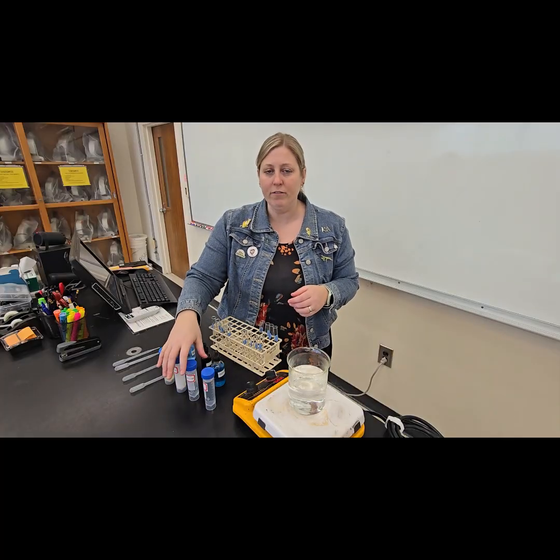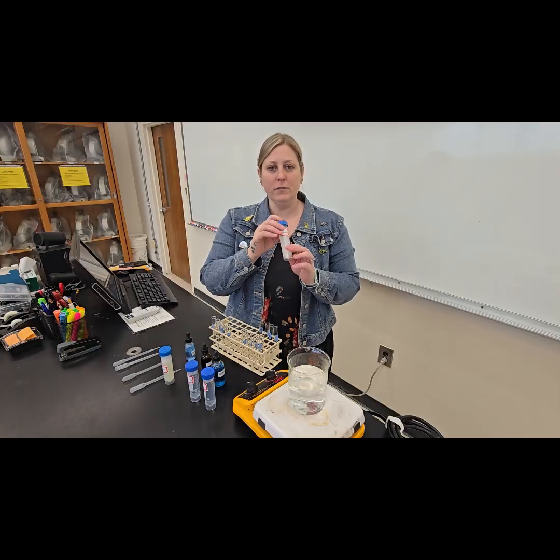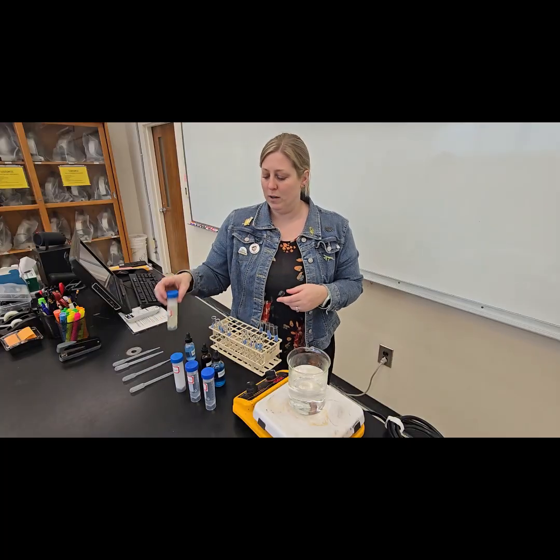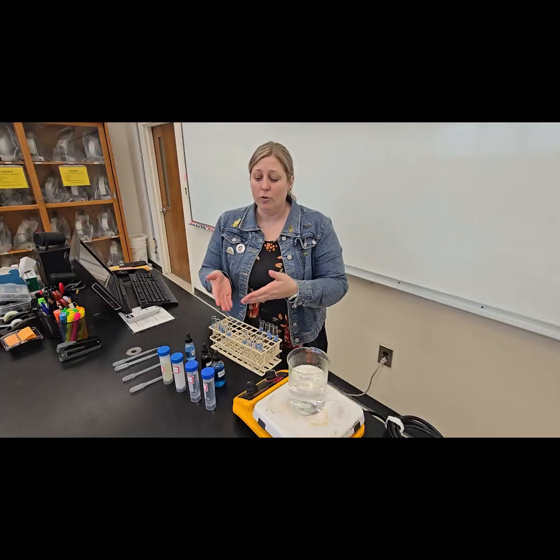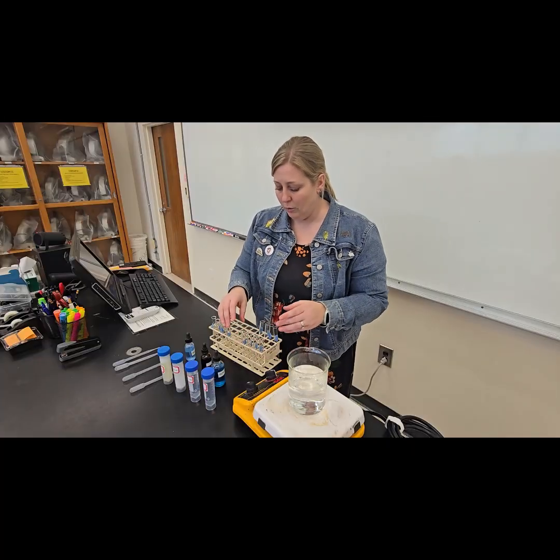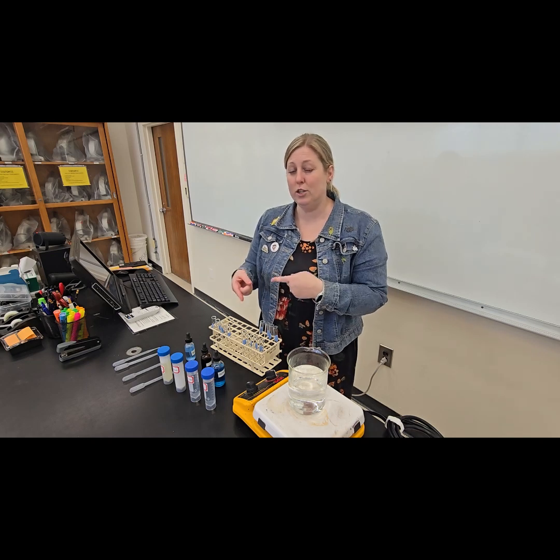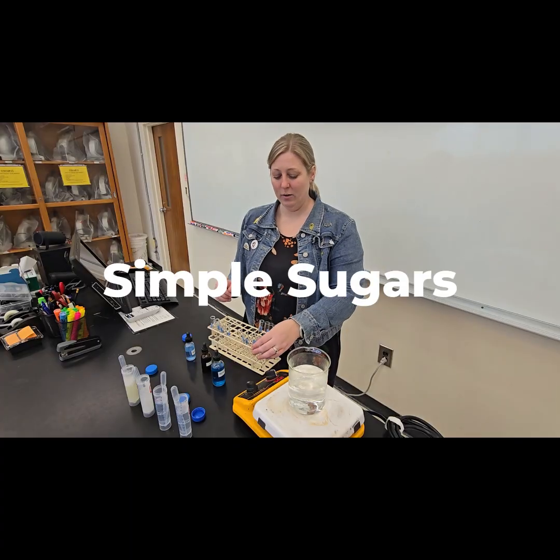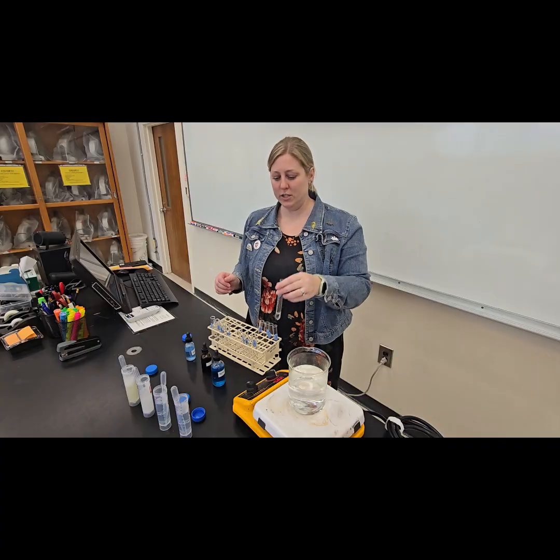So we should have then a positive control for glucose with the simple sugar test, a positive control for starch with the iodine test, and a positive control for albumin with the protein test, and then be able to see what negative responses look like for all of these if it's not going to have that main macromolecule in it. So I'm going to start getting this set up, and you're going to make your hypotheses about what these should be positive or negative.